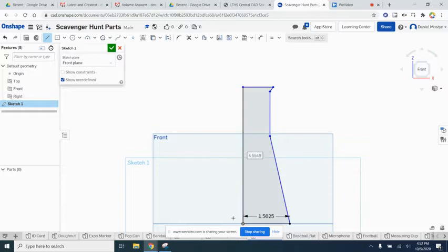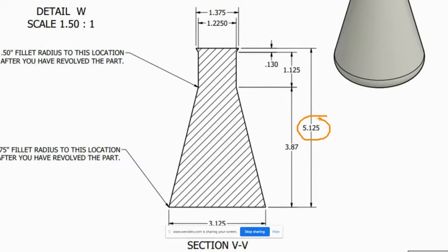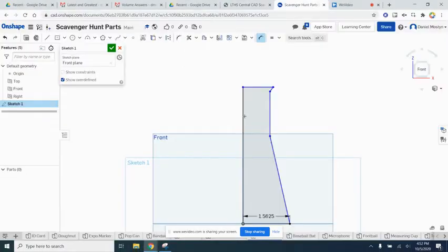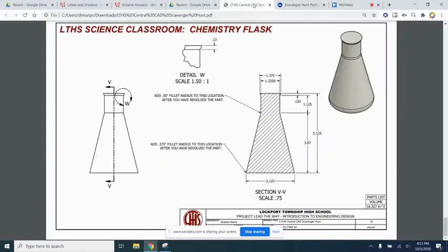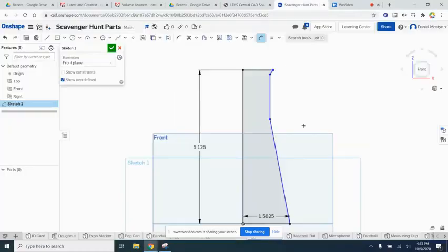All right, so now our goal is to start getting some of these lines to be more defined. We've got to put dimensions in. So let's grab the dimension tool and see what we can do. The overall dimension is 5.125, so let's put that in. That would be from here to here, 5.125. All right, so that bumps it up a little bit. What else can we put in? We know the distance from the bottom right here up to this point is 3.87, so we put that in. Is that right? Yes, 3.87.